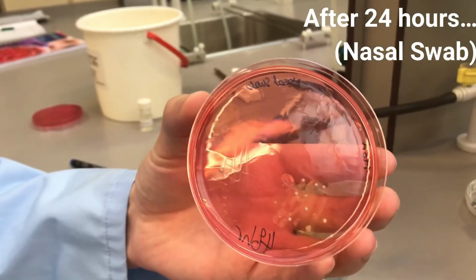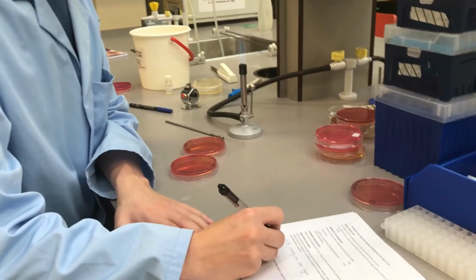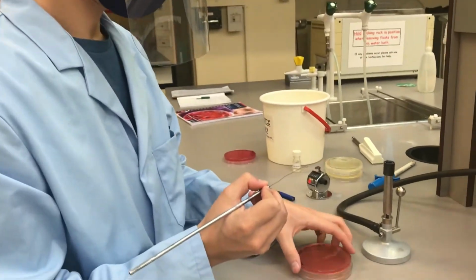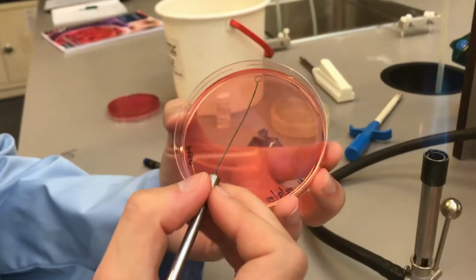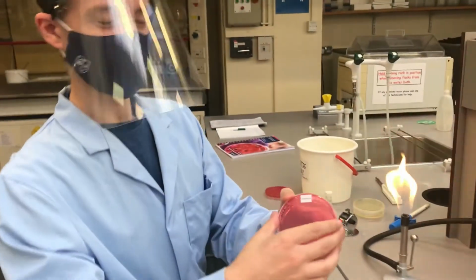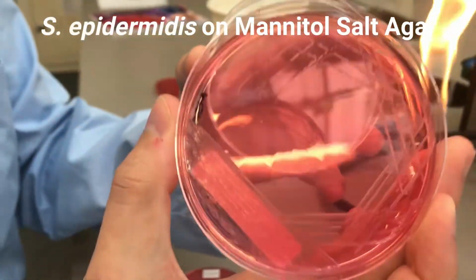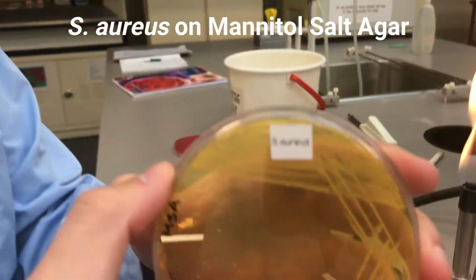We can see that there has been mannitol fermenting growth from the nasal swab. We will again make a note of the colony morphology and select a colony for subculture as before. If we take a look at these control plates, observe the lack of mannitol fermentation with Staph hominis and Staph epidermidis. Now observe the bright yellow colour of the mannitol fermenting Staph aureus.